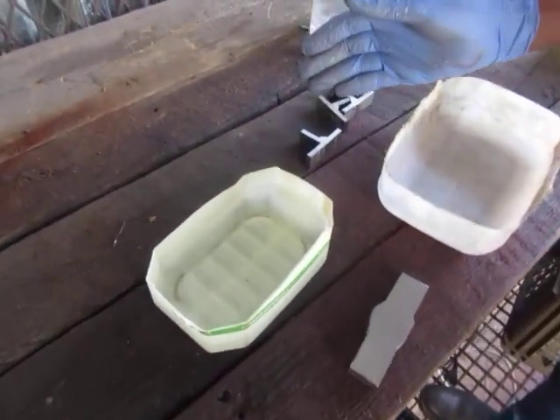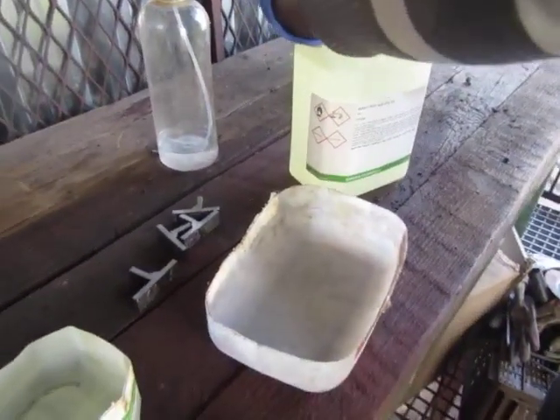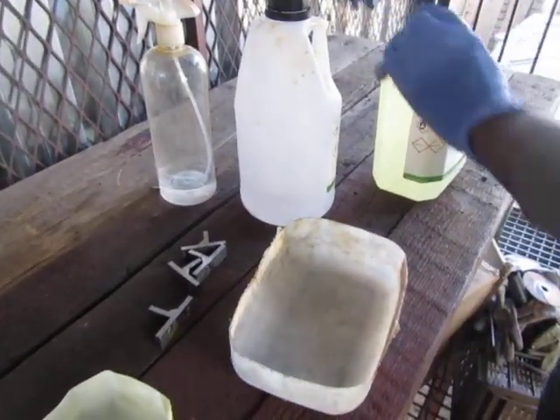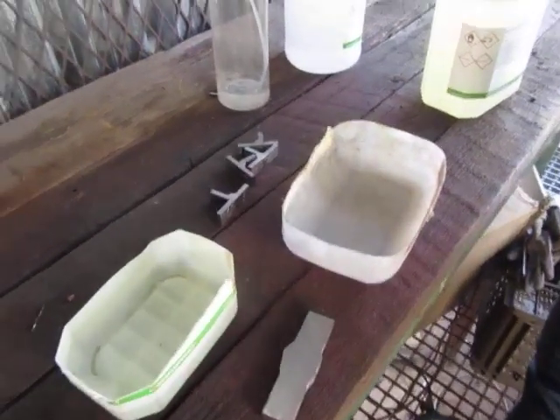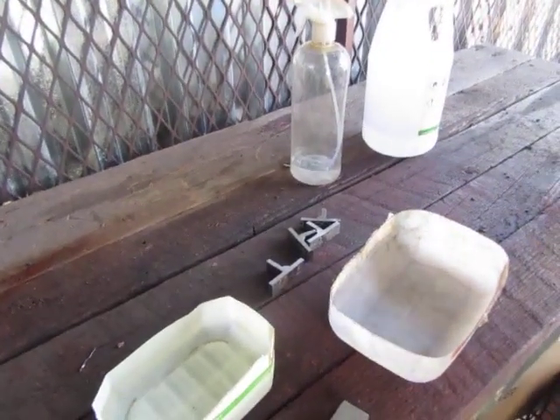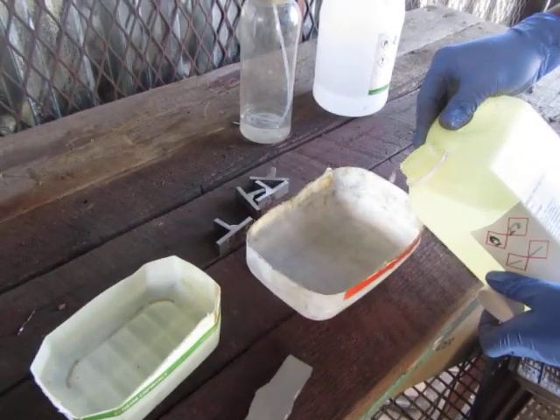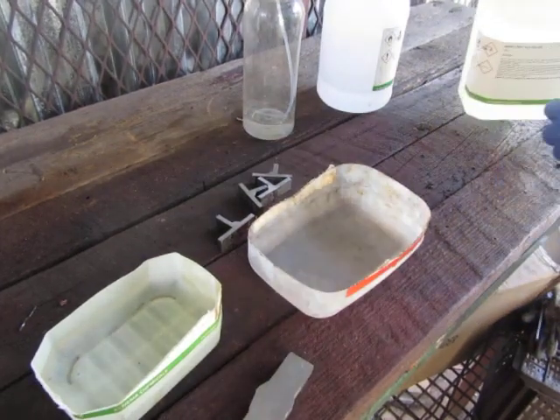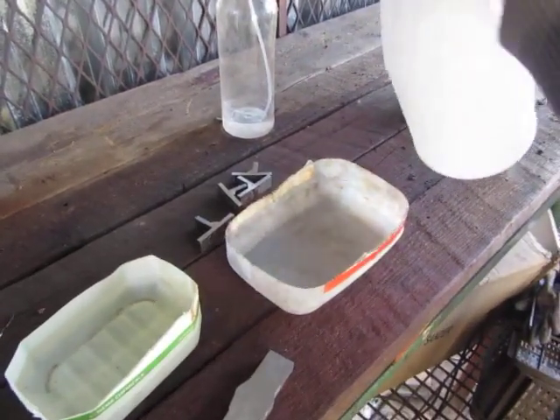This is just normal water, H2O, and here I'm having nitric acid, and here is my alcohol. In order to reveal how the weld looks like, I'm going to mix alcohol and nitric acid — I'm going to do about 40 percent nitric acid. I'll use my judgment as a normal engineer or technician, considering that to be my 40 percent, and then I add this alcohol.